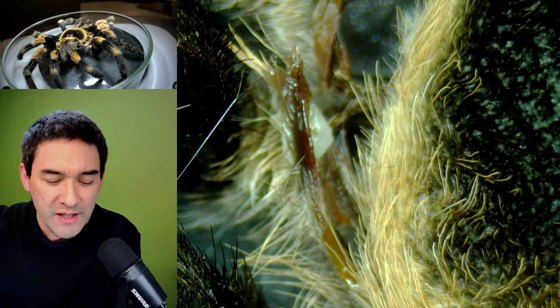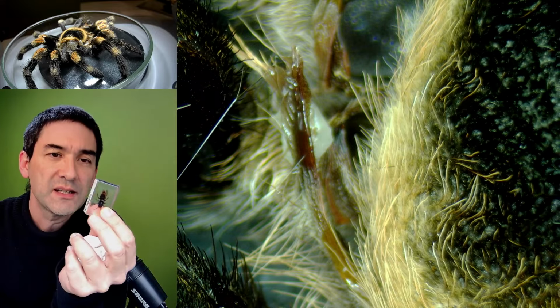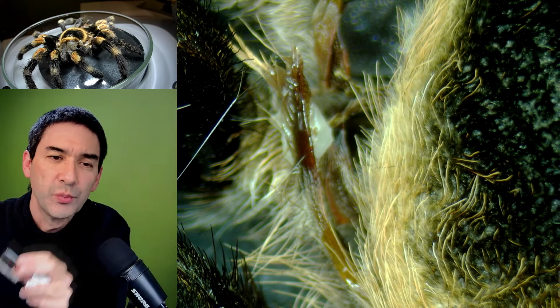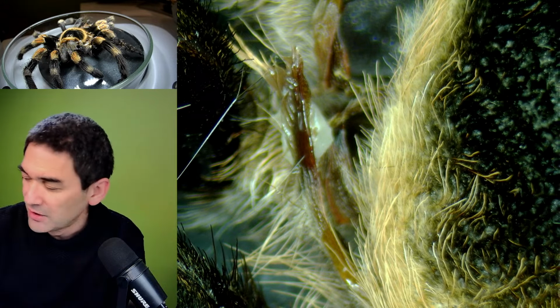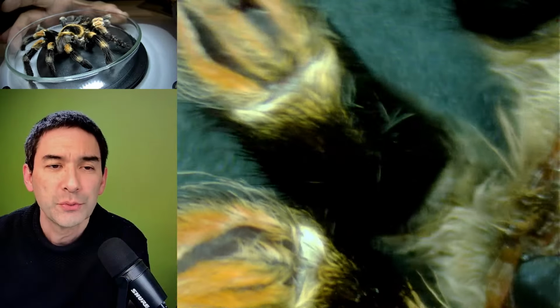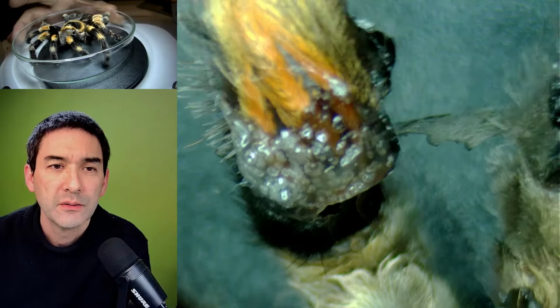It's epoxy resin, just like this one over here, those insects. This seems to be epoxy resin. And this would be an interesting way also to preserve biological specimens. Bleeding luckily stopped. And I wonder if it's not possible also to preserve the spider in this way. So look at this here.